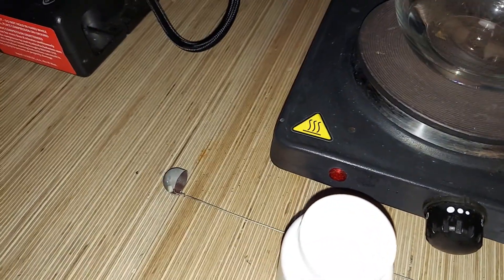Of course I'll remove the top. Once that's flowing well, I'm going to take this small scooper, put the chromium oxide in it, then heat it up and put it in there.